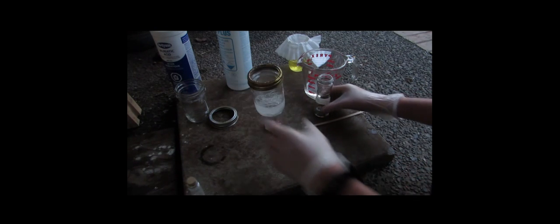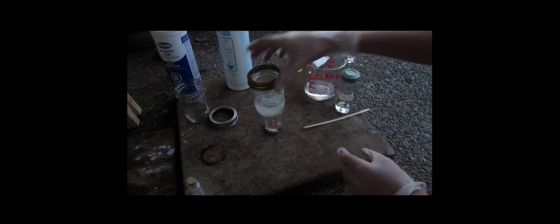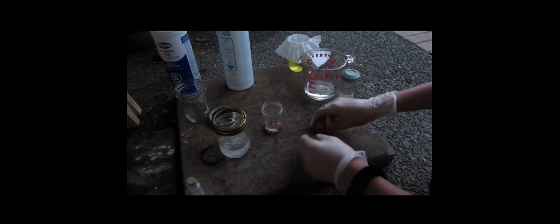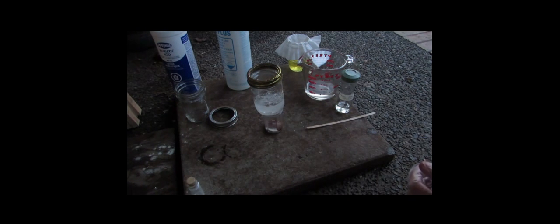So, we're going to carefully open up the sulfuric acid, and then get our jar ready. Well, it doesn't seem to be doing much, but it did turn a dark red color. Perhaps I should have heated the sulfuric acid beforehand. Oh wait, there is vapor coming off. I'm just going to leave that there and see what happens. I'll be back if anything happens.